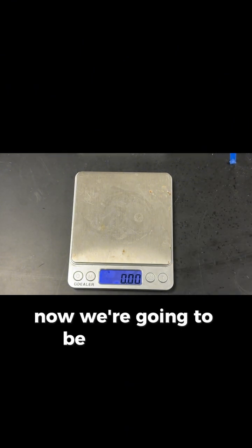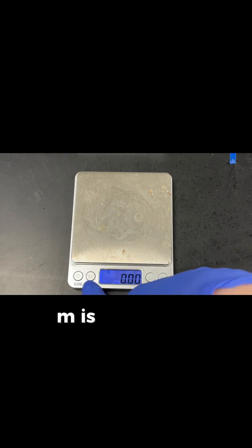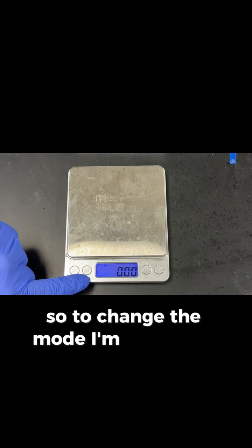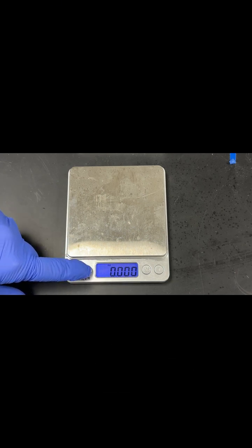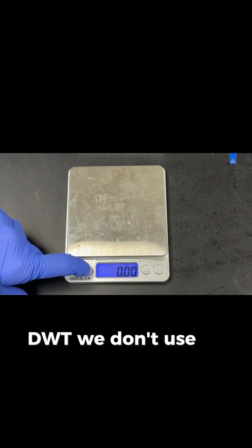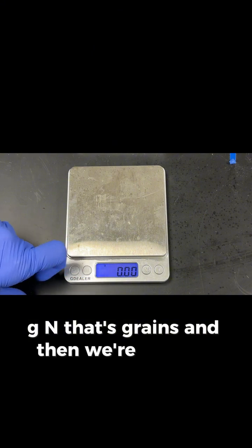Now we're going to be looking at different modes. And so if you hit M, M is the mode button, and this sets which mode it's measuring in. So to change the mode, I'm gonna hit the M button, and now OZ is ounces. We have another ounce. DWT we don't use. CT, that's carat. GN, that's grains. And then we're back to grams.